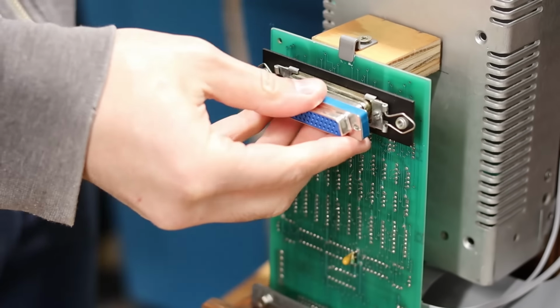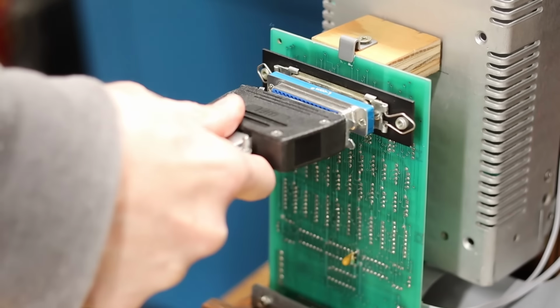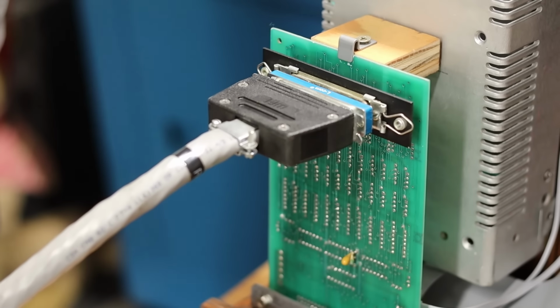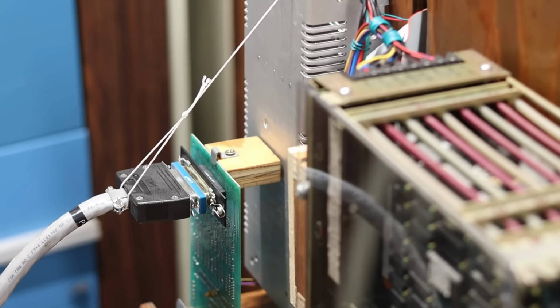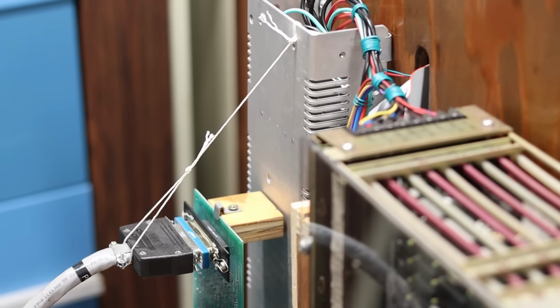$50 later and here we go, but really, I shouldn't need this at all. Something is not right here. Still, let's soldier on and find out what is not right. The cable was a bit heavy, so I put a bit of string on it to support it, and this is super jank, but remember, it's really only temporary.